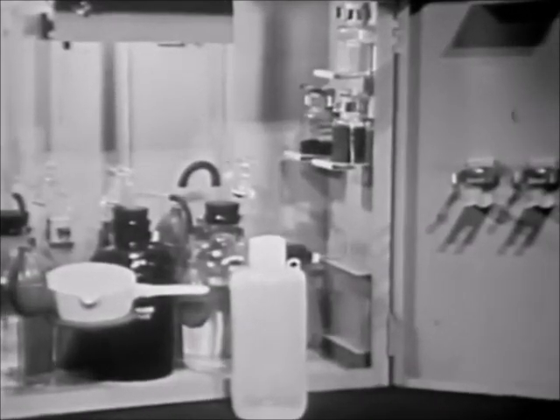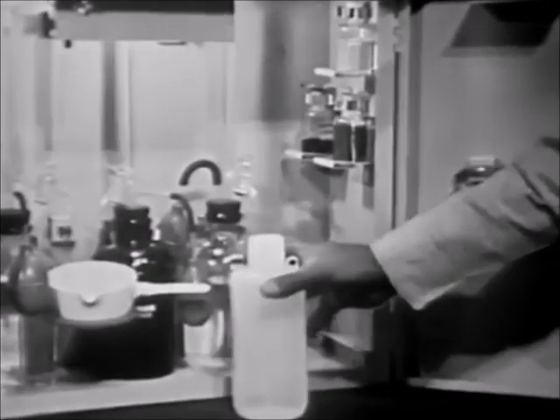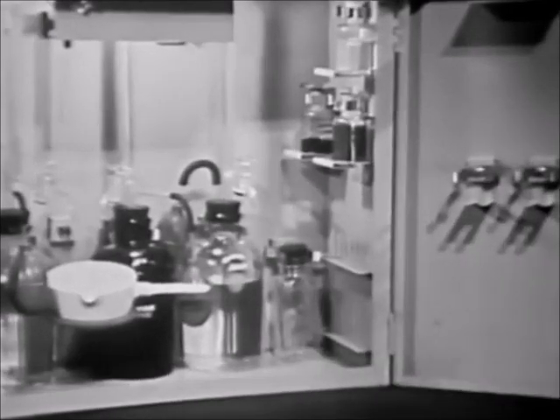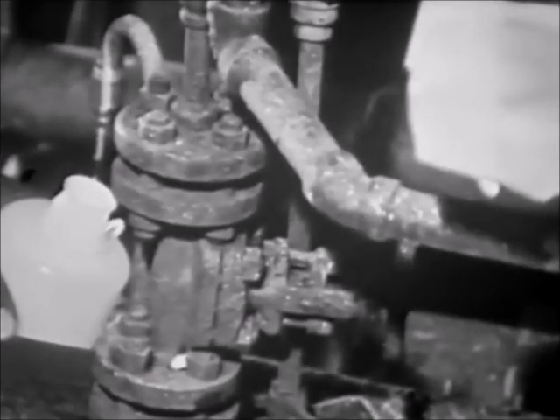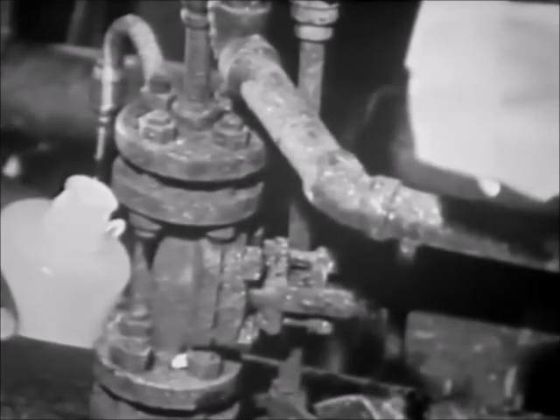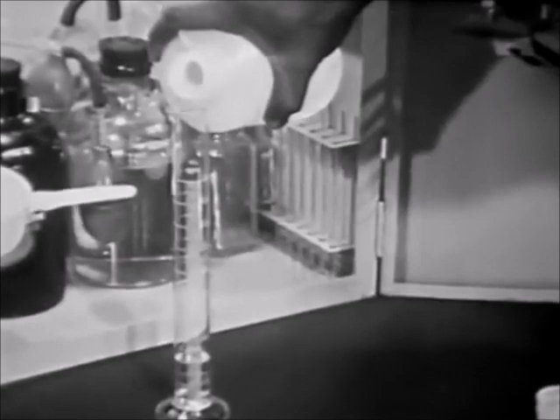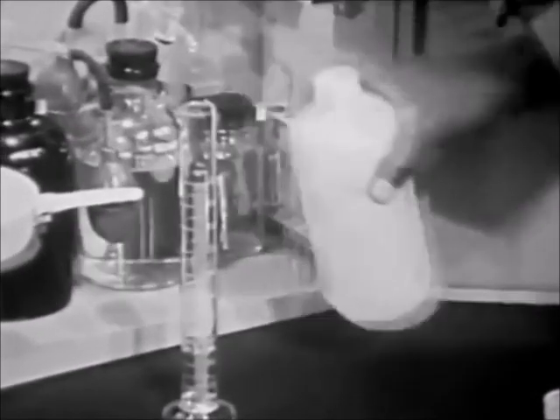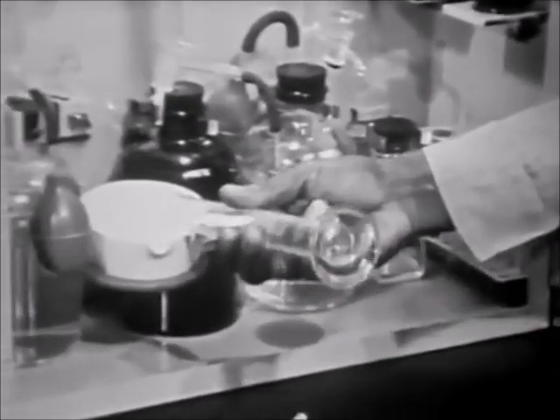You are now ready to run the test itself, in this instance on boiler water. Use a clean plastic bottle to draw a sample of water. Let the water flow freely from the sampling connection to clear it of stagnant water and sediment before you take a sample. Measure out 25 milliliters of water and place it in a clean casserole.